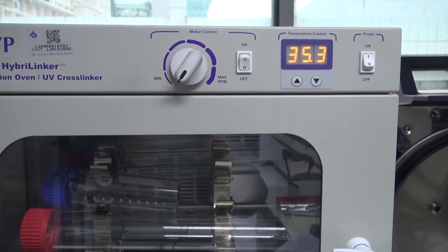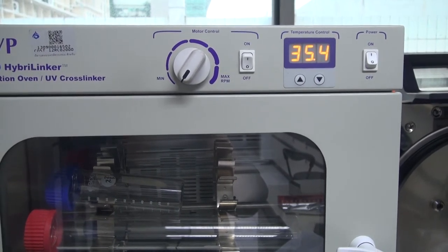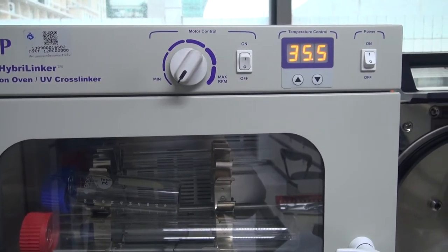Please remind that the bottle should not be used at the temperature above 70 degrees Celsius.